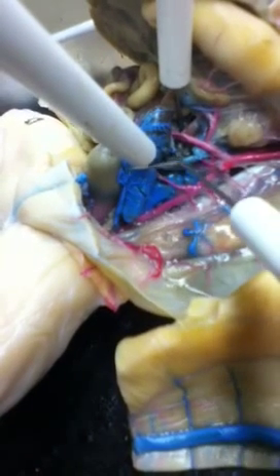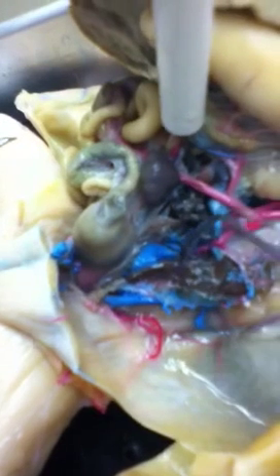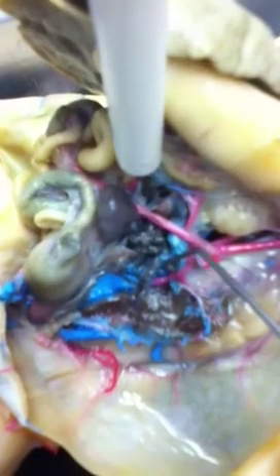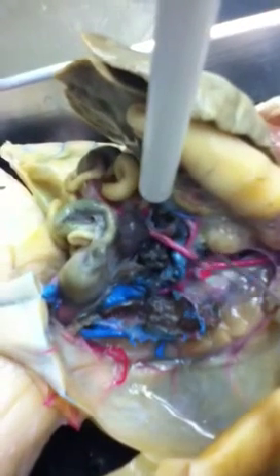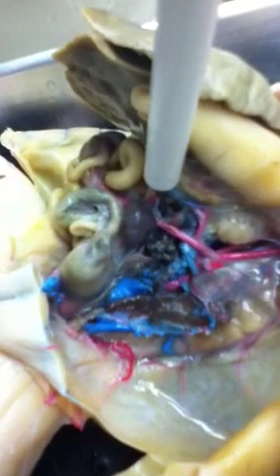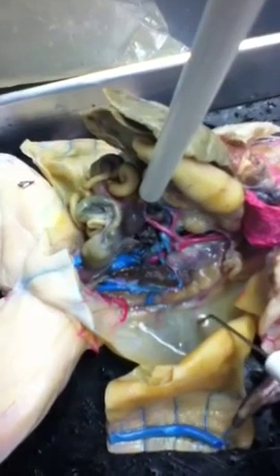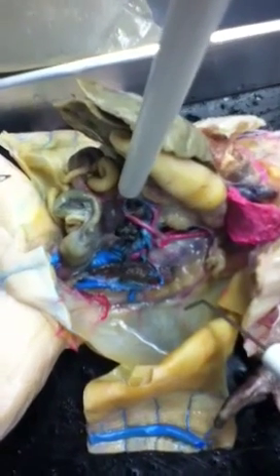We have a vein coming off the kidney right here — that's going to be the renal portal vein. This dark blue vein here is the posterior vena cava, and any vein coming off the posterior vena cava to the kidney is called the renal vein. That covers all the veins and arteries you need to know for the quiz on Monday and the test this week.